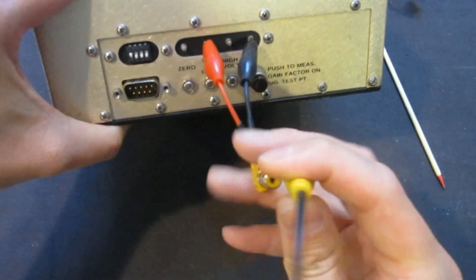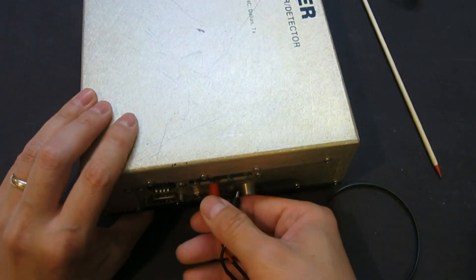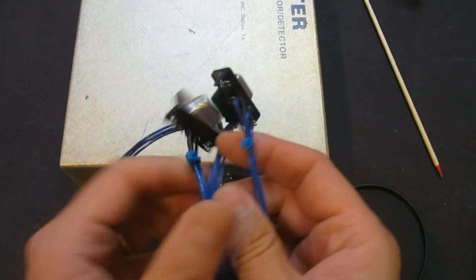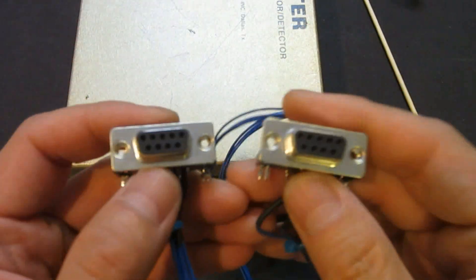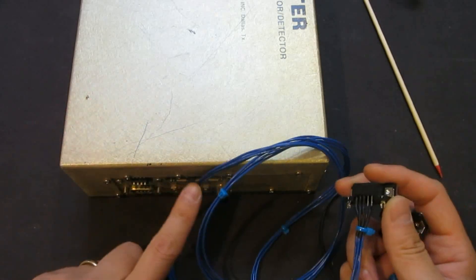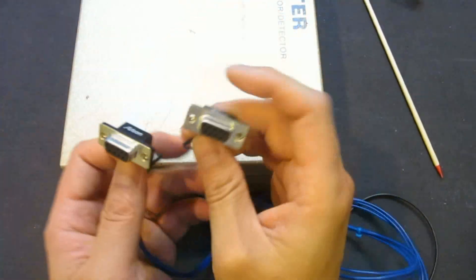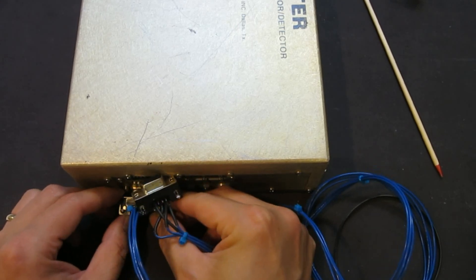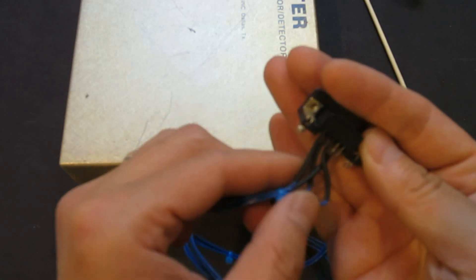So I can put one side of the cable here and the other side can go to the Arduino shield I built. I also built a cable with two nine-pin connectors — kind of like the standard serial port connectors. Basically it takes out the voltage output. I'm only using the measurements from here, but if I plan in the future to do something different, I can probably use it. The idea is to plug one end in here and the other into a modified power supply, because I also have the plus and minus 15 volts routed out of the cable.